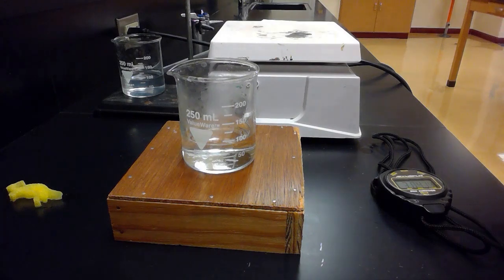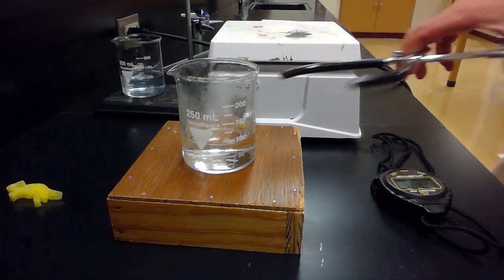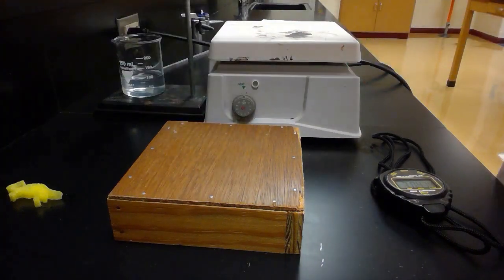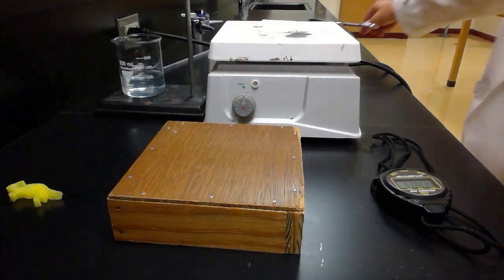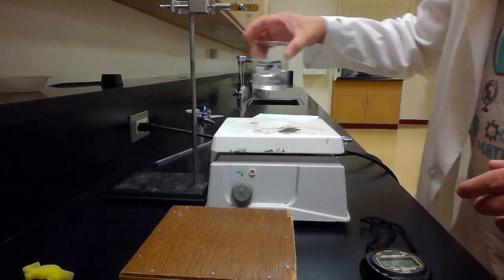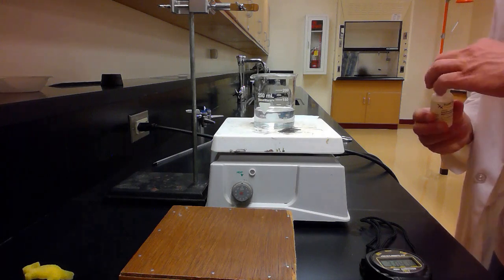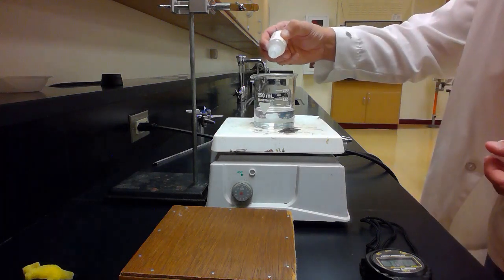Alright. So now, let me get my acidic water out of the way and set up my alkaline water. Just to make sure this is alkaline, I put a drop of phenolphthalein in there.